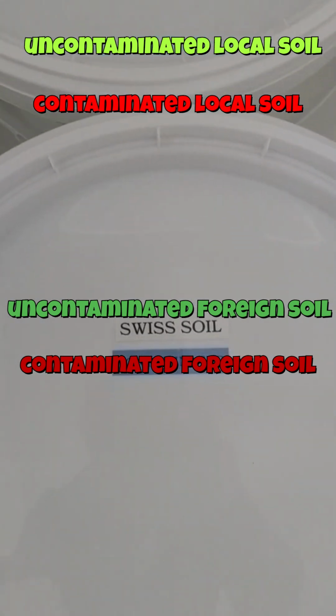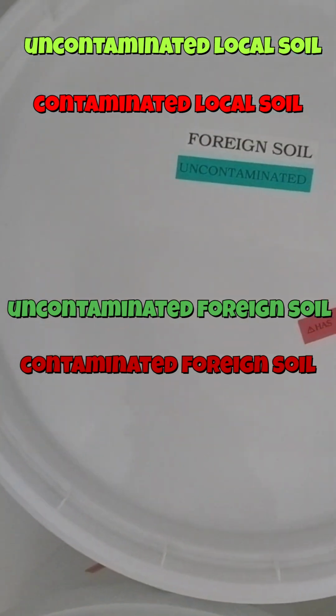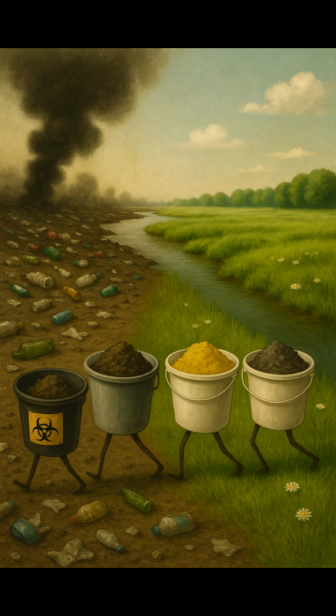Now, why do we make this distinction? The reason is simple. All soil from outside Switzerland, even if it's clean, has to be autoclaved before disposal. That's a legal requirement to prevent the spread of invasive species or pathogens. On the other hand, contaminated soil has to be treated as hazardous waste. So really, these 4 categories are all we need.